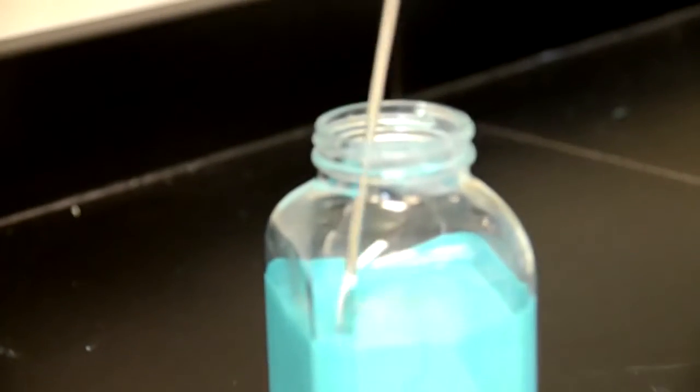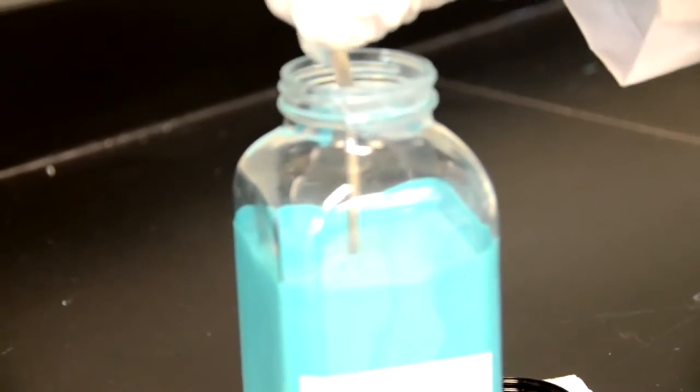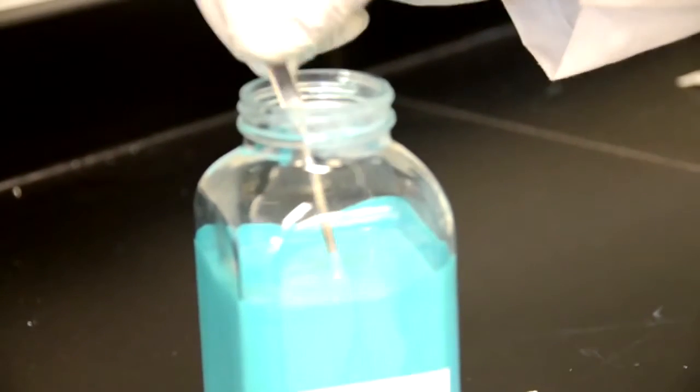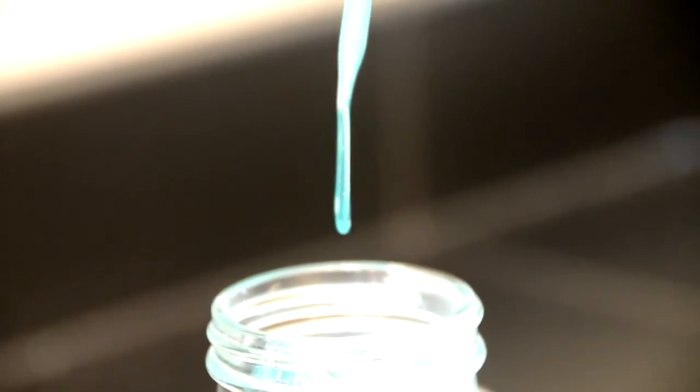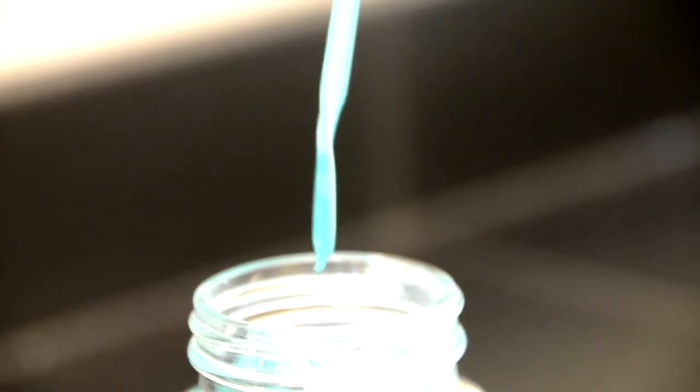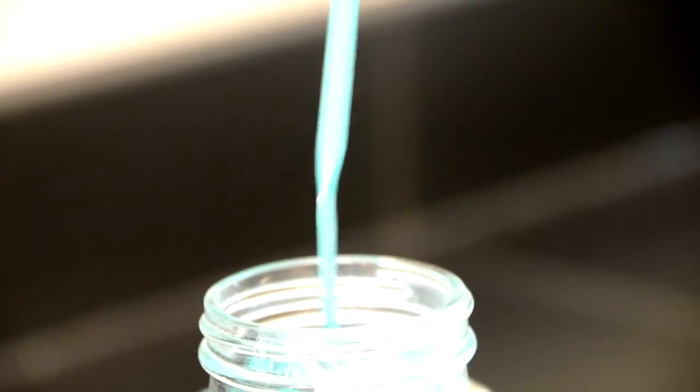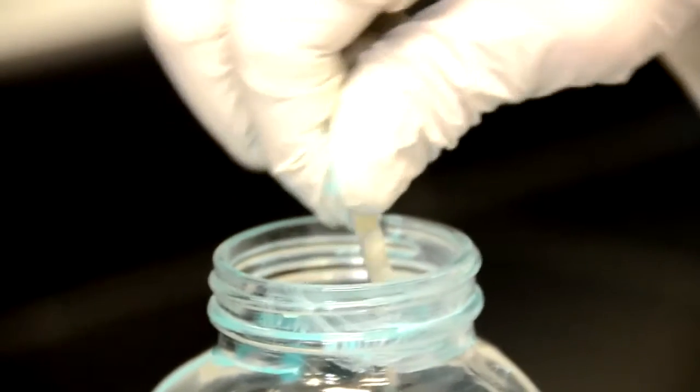And probing this, you feel for the sedimentation or separation at the bottom. I don't feel any. You look at the end of the spatula, there is no indication of a bulb or buildup after scraping the bottom of the jar.